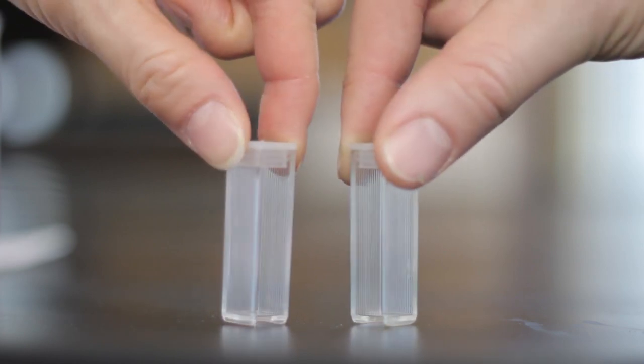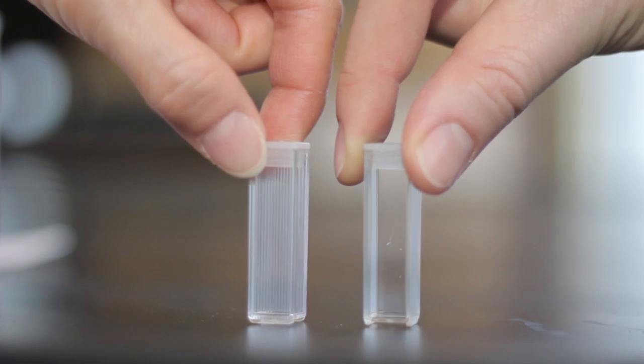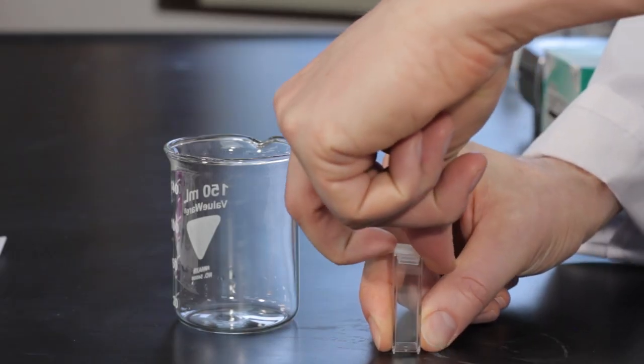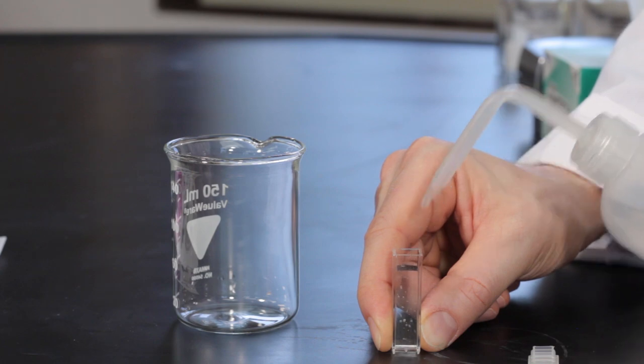Obtain 2 cuvettes. When using cuvettes, you should always hold cuvettes by the top edges of their ribbed sides. They should never be more than 3 quarter filled.